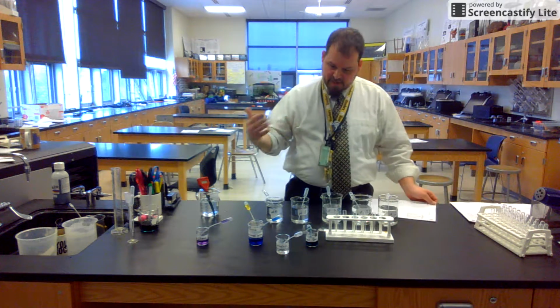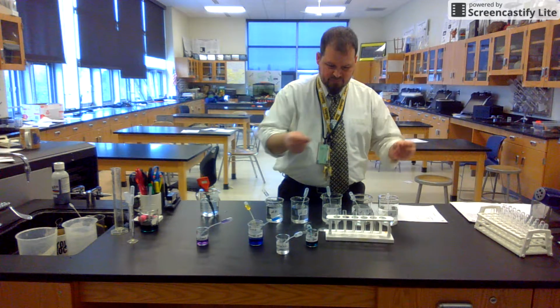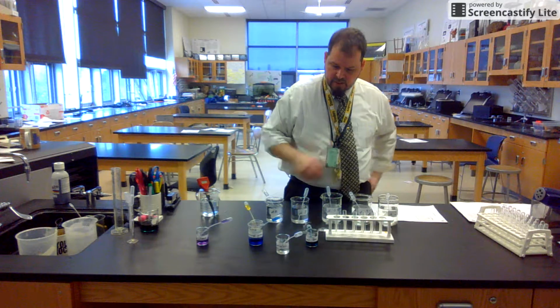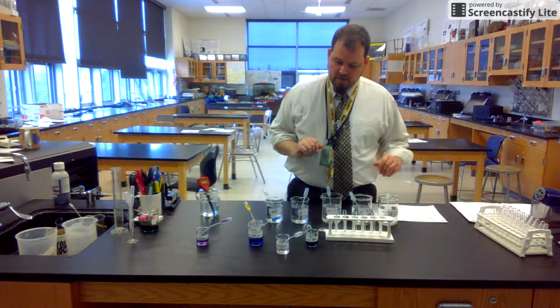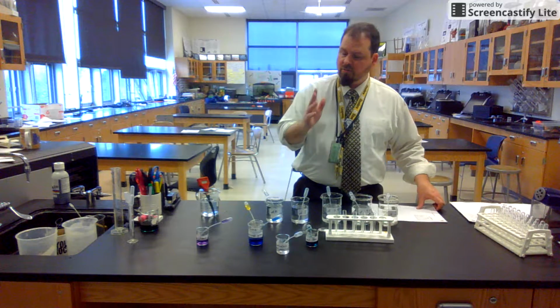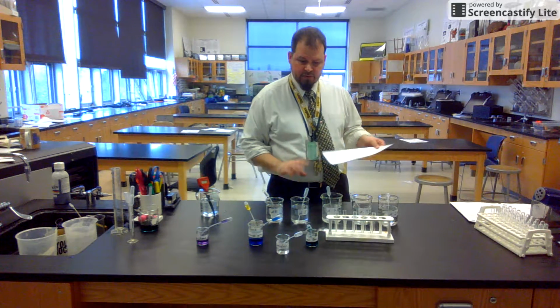The thing is that we have to take turns. I only have so many chemicals. So it's kind of a lot to do. I need to use all 5 of these, and I need to use one of those. So we can get a few groups working as long as we're working safely. And I have lots of test tubes, so we're good there. It's just there's a limited amount of beakers for the actual chemicals, so we will have to take turns. Otherwise, it should be pretty fast to get through all 5 indicators and get some data results.